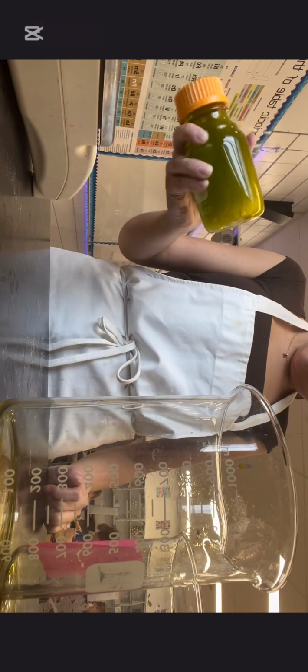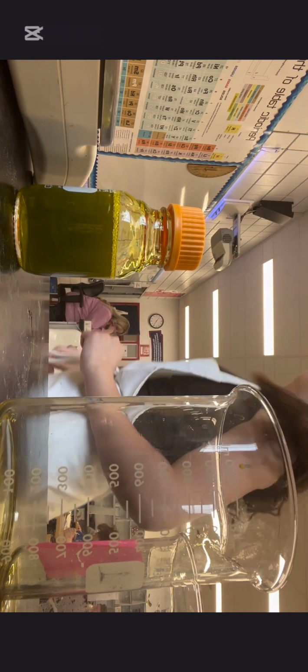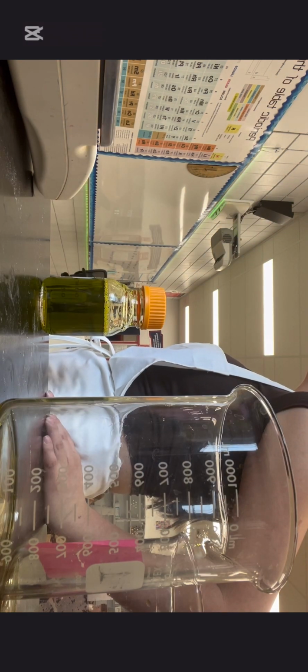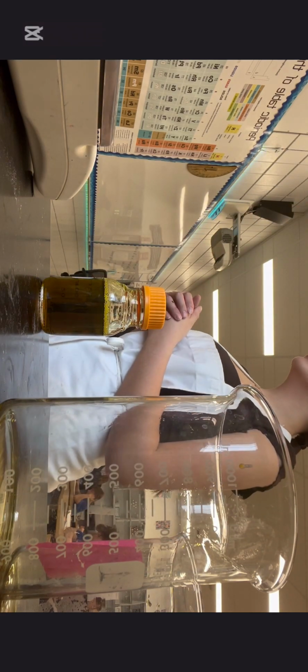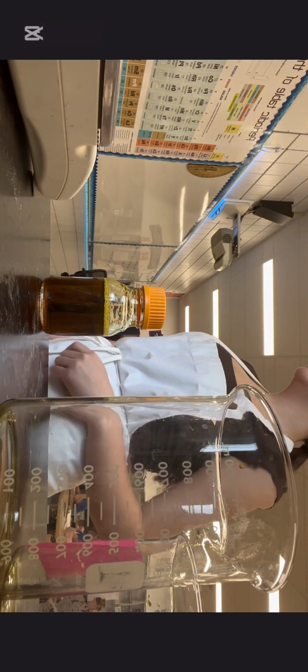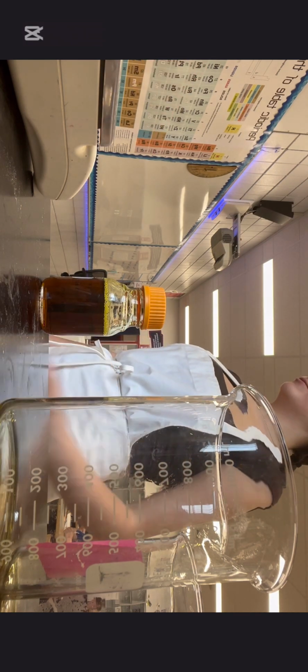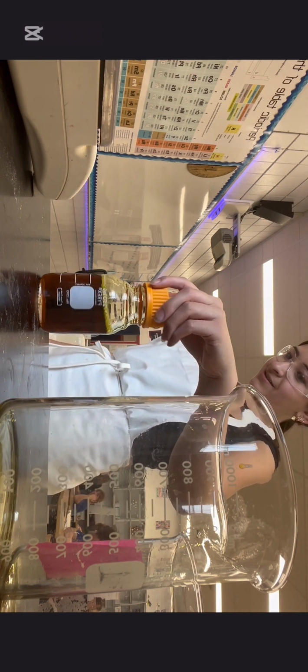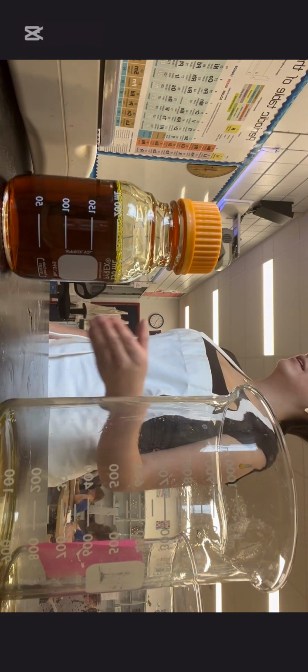And then I let it sit in that bottle to see if it would change back to red and then yellow. I think right here I was explaining how it was supposed to change. I was getting a little bit frustrated, but then I saw it turn red, so I figured it was working.